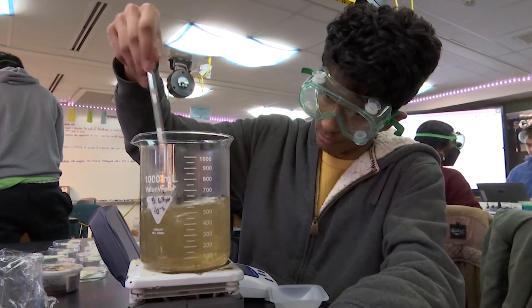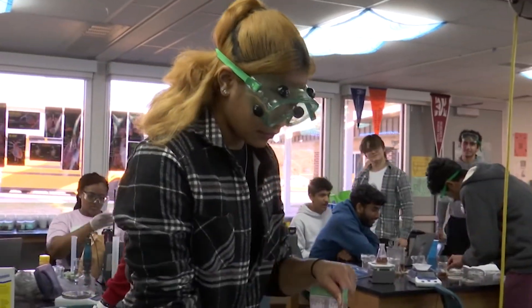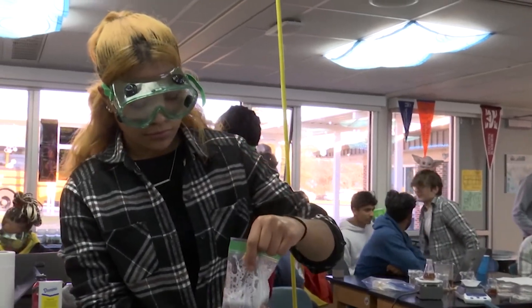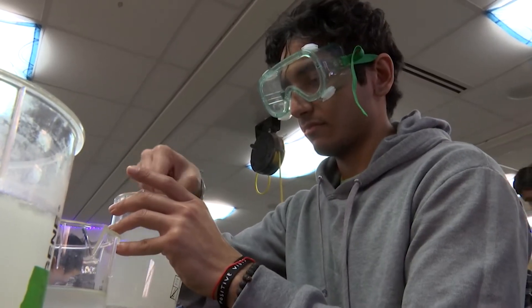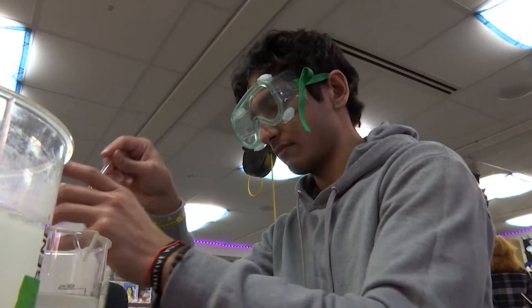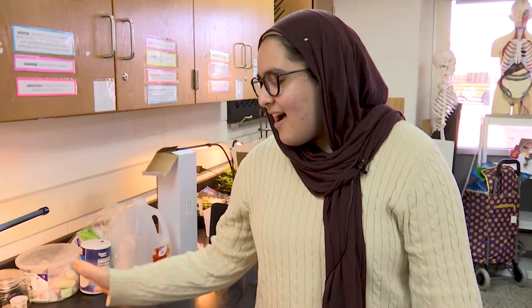These are IB seniors in the IBDP program, the International Baccalaureate Diploma program. What they're working on right now for biology is their internal assessment. They are responsible for creating and developing a research question that is personal and relevant to them.